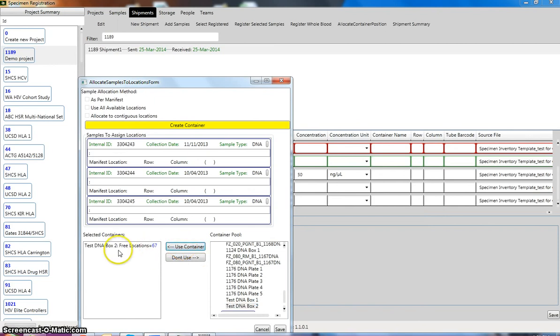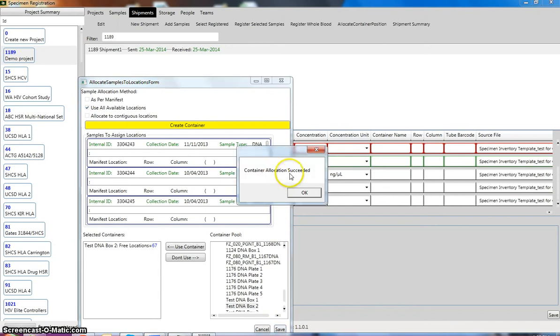and it will pop up here, and it will tell you how many free locations there are in this container. Since I don't have what positions they're meant to be in, I can't use as per manifest. So what I would choose is use all available locations. If you click on that, we'll know what are the next available locations to place these samples in. And then you just click on save, and container allocation succeeded, so that's been registered into a container, and you just click OK, cancel that.